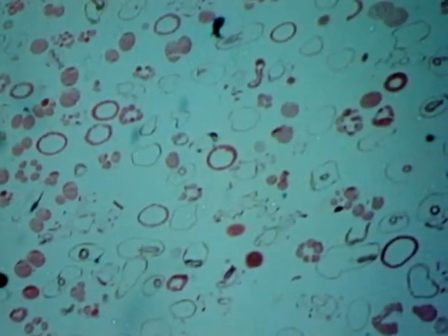So many of these slides. So you said the rings were what? Blastula or blastocyst. Okay. Either one.